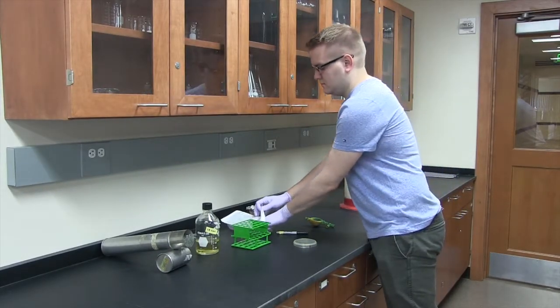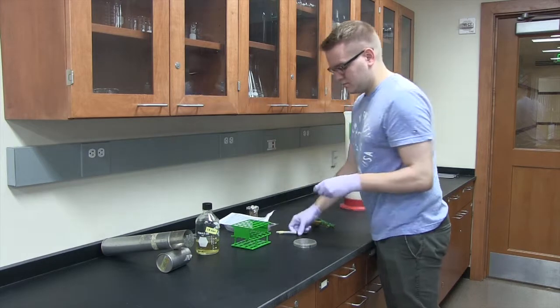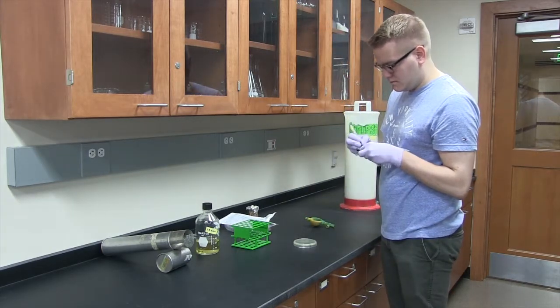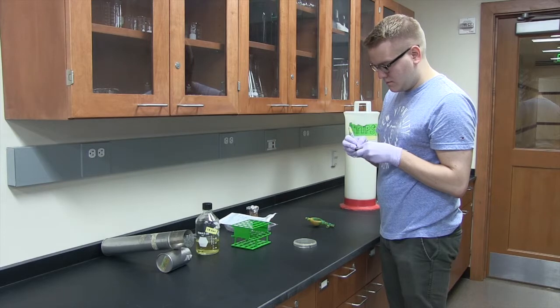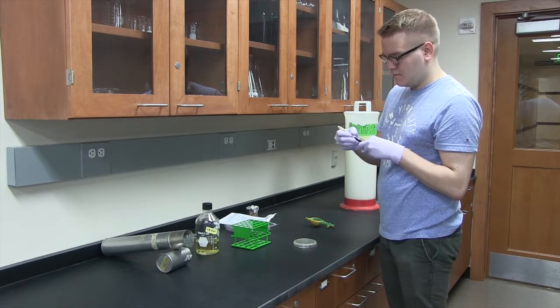So the first thing you need to do is find test tubes and label them. Dominic's just going to do one, but you'll do three for your experiment. And you want to label them so that you'll be able to find your tubes during your lab period.